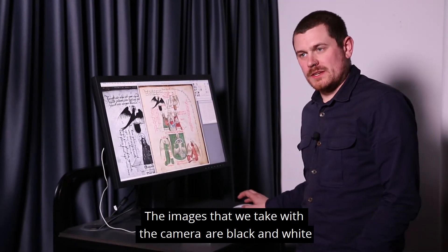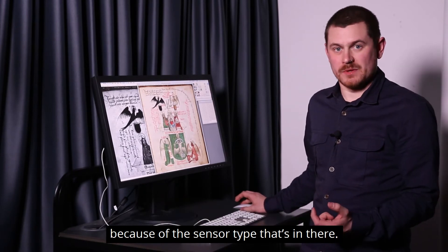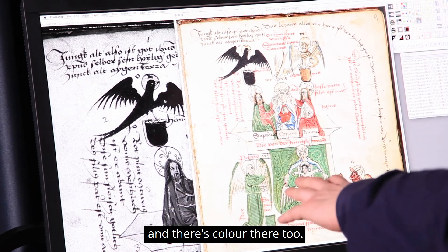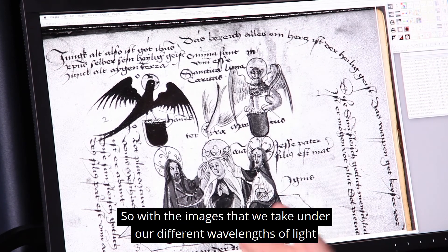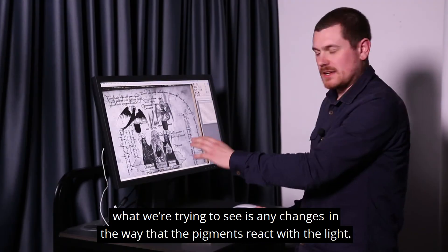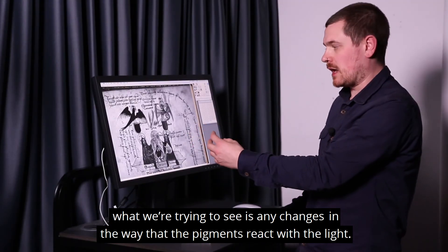The images we take with the camera are black and white because of the sensor type. This is a colour image and you can see where the text is black and there's colour there too. With the images taken under different wavelengths of light, what we're trying to see is any changes in the way the pigments react with the light.